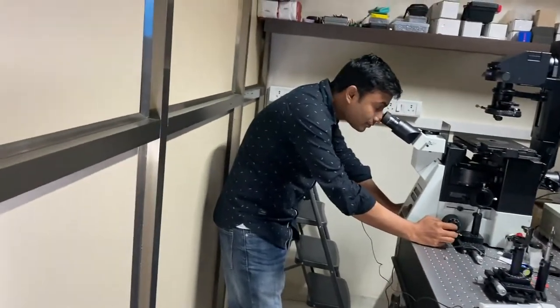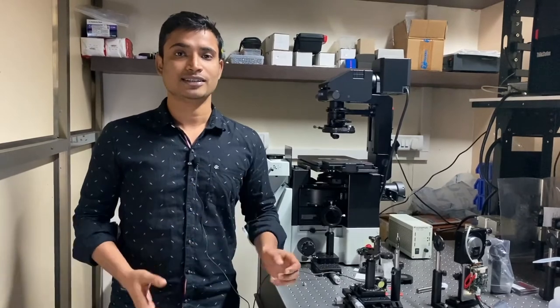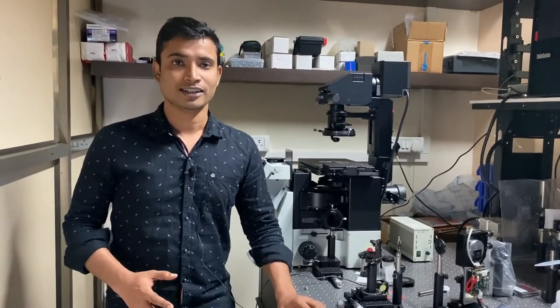We are now going into the microscopy room. Satya, can I talk to you? Pravar showed me some cells under a microscope — they looked really good — but I didn't follow how the microscope works. Can you help me out? An optical microscope is an instrument developed to produce magnified and resolved images of things we can't see with our naked eyes.